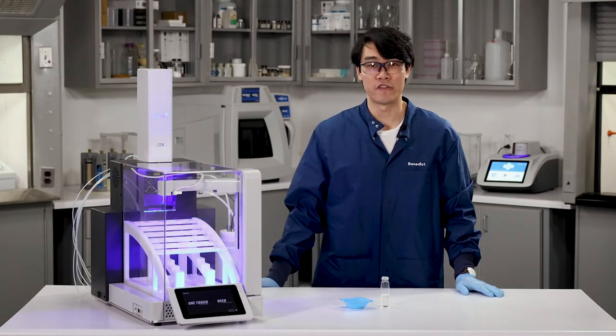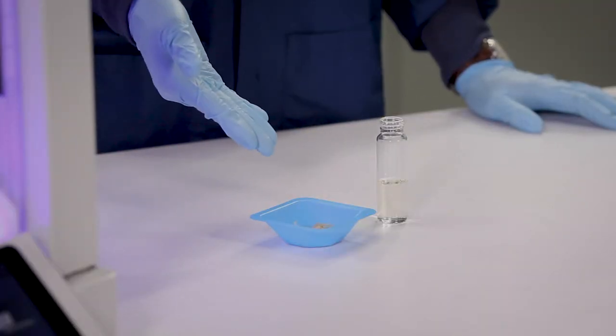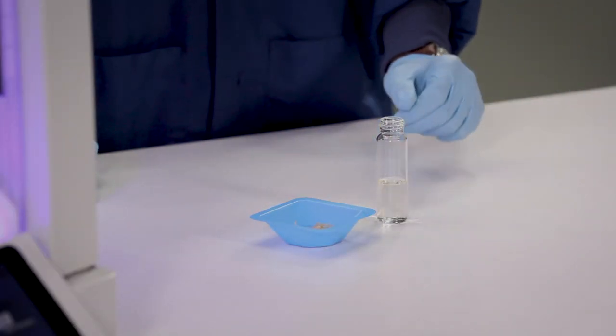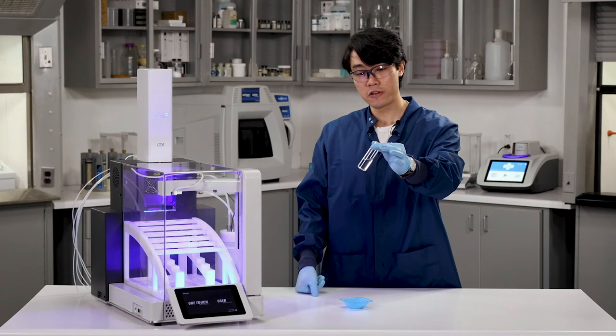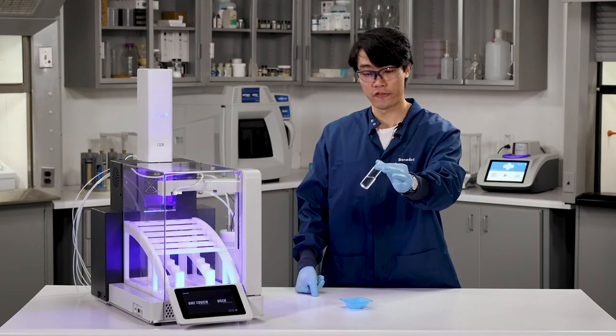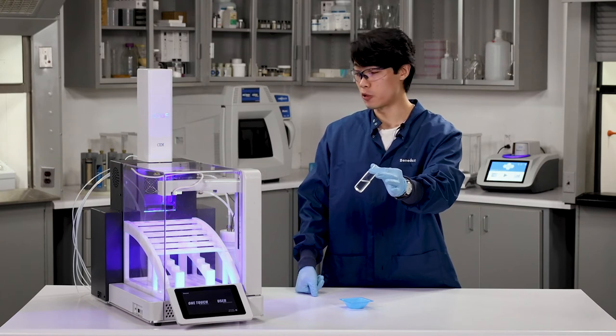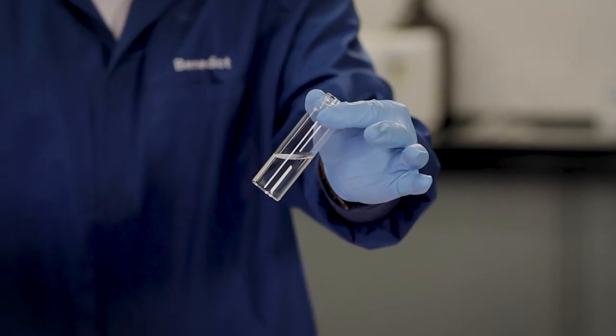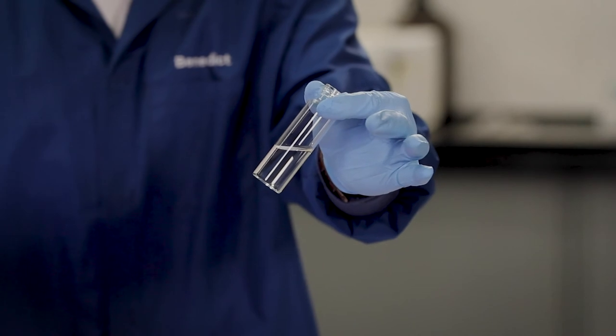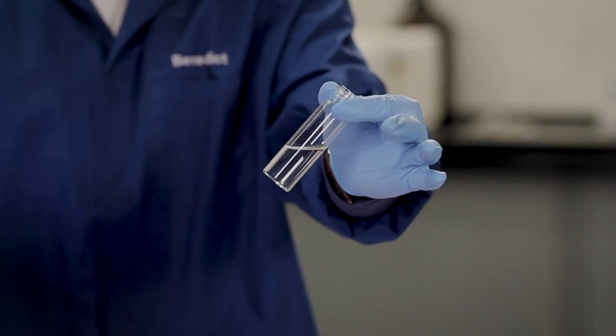All right, and now that the Edge has finished running, we have our extracted sample and our extract. You can see here that our extract is nicely filtered and cooled, filtered due to that Q-disk that we put in, and cooled from the cooling coil that's in the back of the Edge. And the analytes that you might be looking for in this extract include things like mycotoxins or fat.